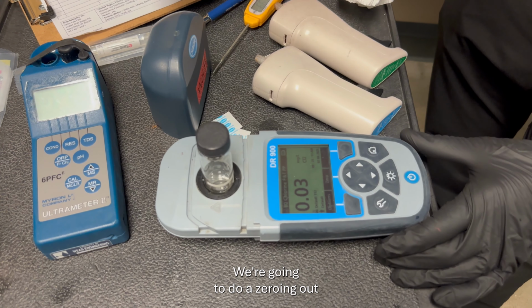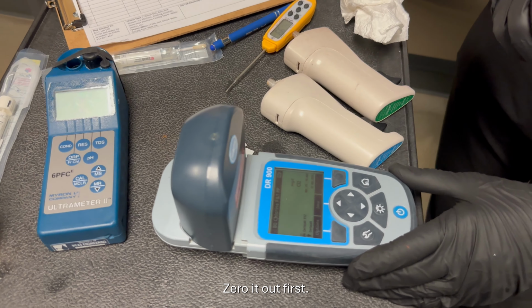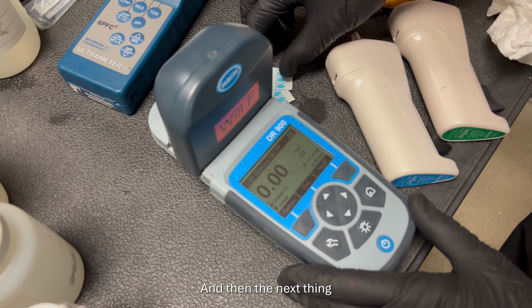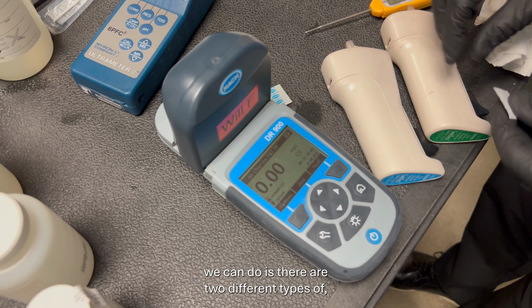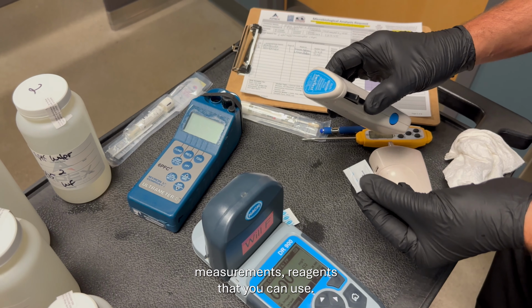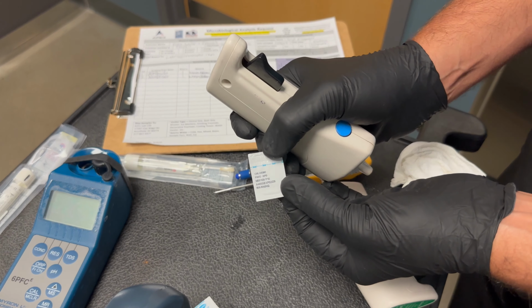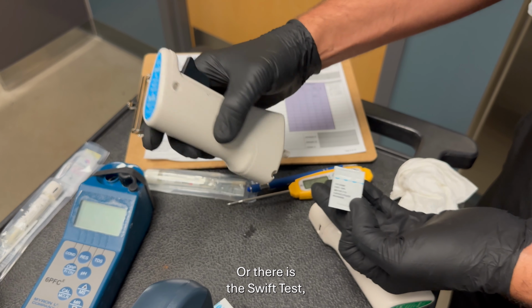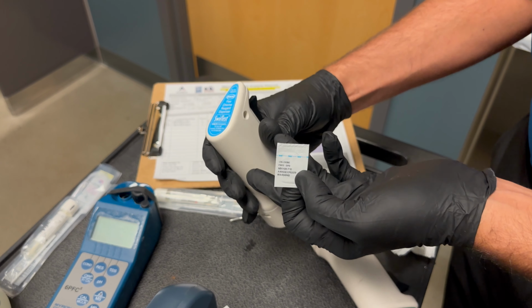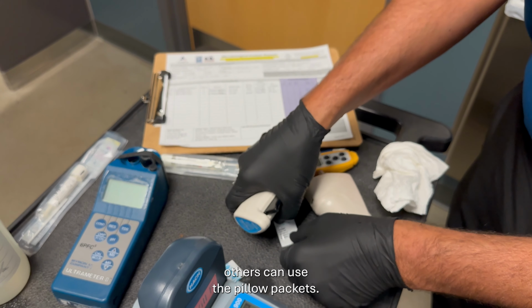We're going to do a zeroing out with the diamond facing us. Zero it out first. And then the next thing is that there are two different types of reagents that you can use. Most commonly used is a free chlorine packet, or there is the Swift test, which is essentially 250 of these inside of a vial that's inside of this unit. So I like to use these, but others, you can use the pillow packets.